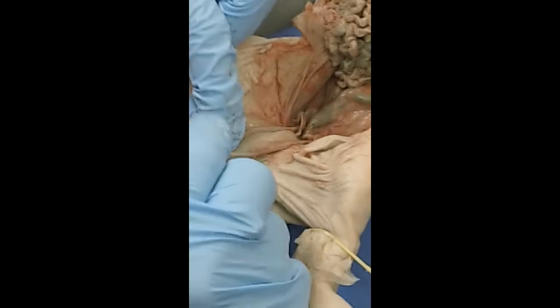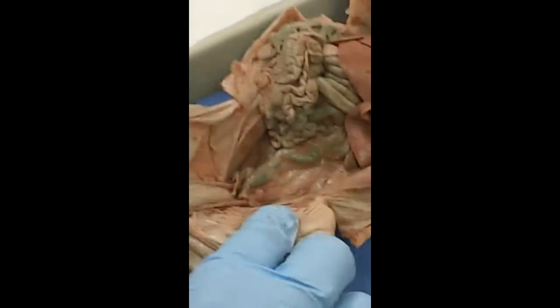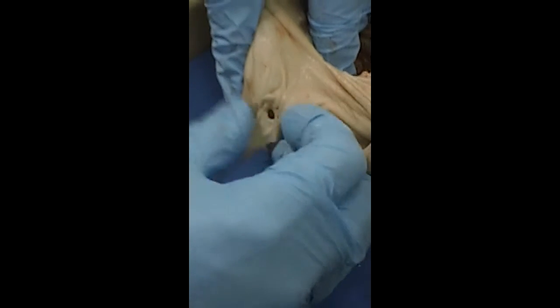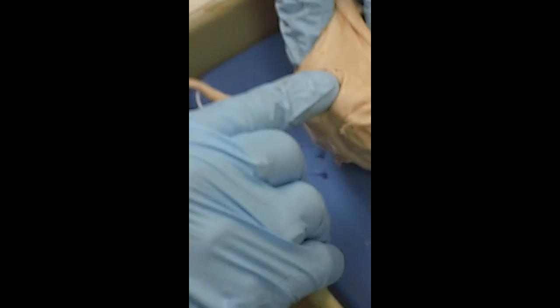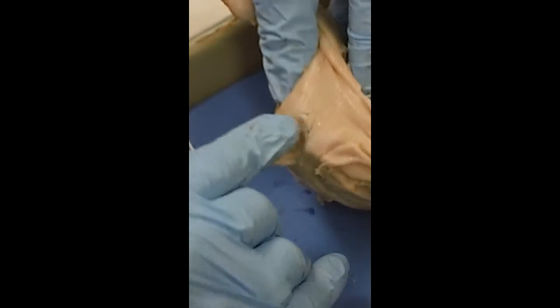And then when we have to go to the bathroom, we release it and it goes out the urethra. This is a girl pig, and so the urethra would actually open up back here. That's the anus, which leads to the digestive tract. And then right here is an opening that is to the vagina and also to the urethra for the exit of the urine.